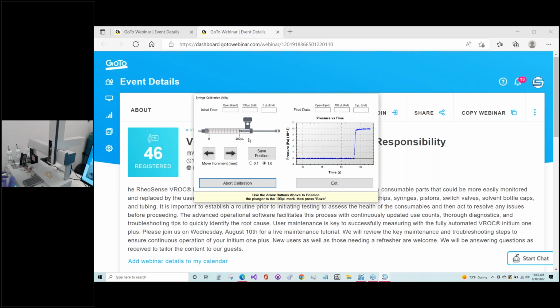So once you notice that it's not pressurizing, that's when you will come in and you'll need to double check to make sure that the tip of the piston is on the 100 microliter mark. To do that, you need to visually come and take a look. This one's pretty far, so I'm going to use the controls that are here to move the tip closer. And you have 0.1 and 1 increments. So just looking at it at first, it looks kind of far. So I'm going to move it by 1 at first.